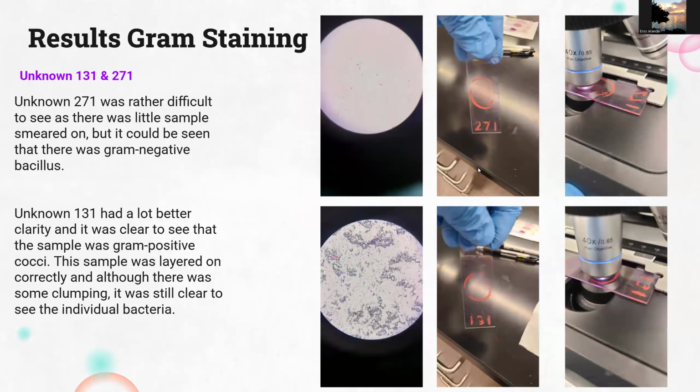Now for the gram staining of our unknowns. On unknown 271, I'll be honest with you, it was really difficult to see. Biggest reason is that I even noticed in our culture, it had really small colonies. It's real hard to grab some. So it wasn't too easy to see, but it was known to be gram-negative bacillus.